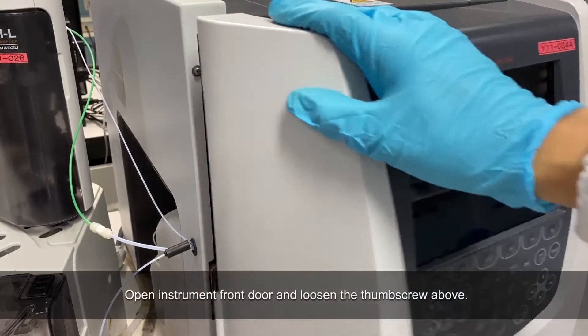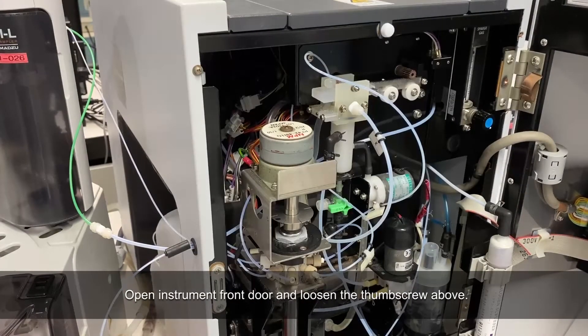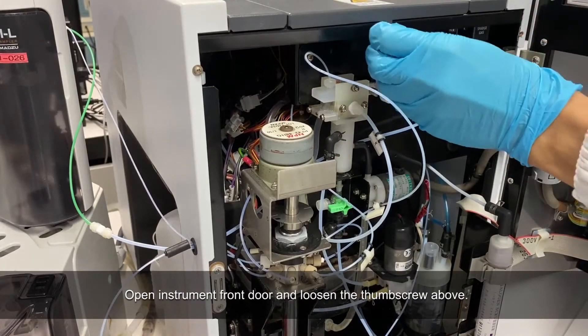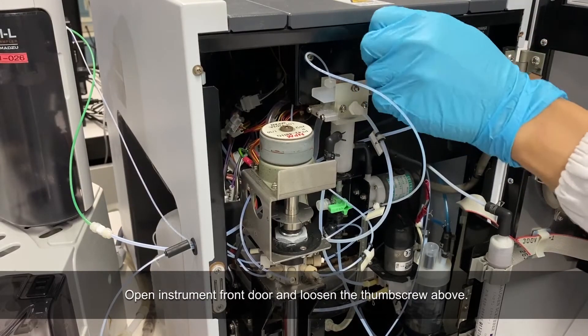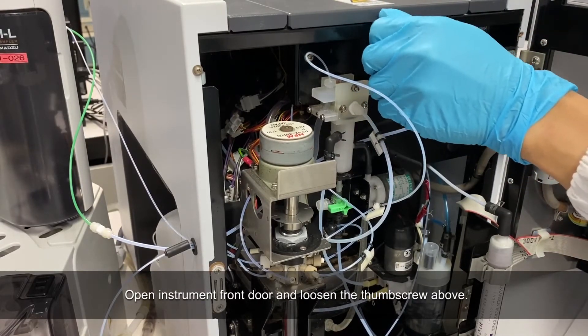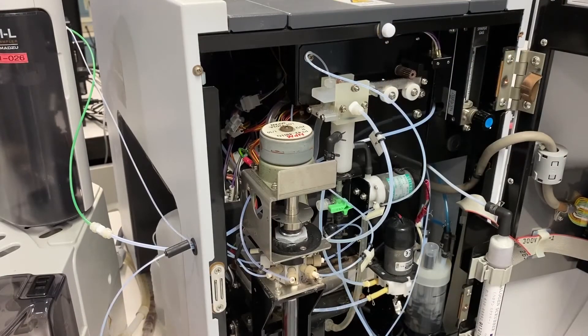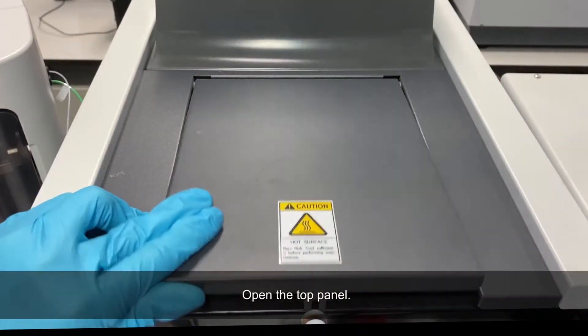Open the front door of the instrument and loosen the thumb screw above. Open the top panel.